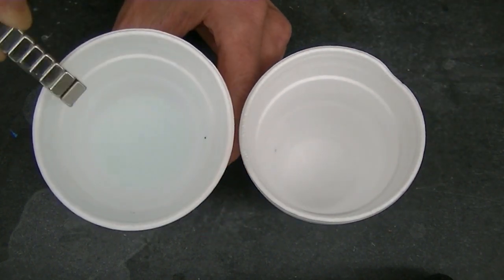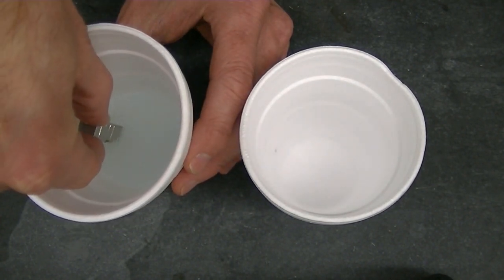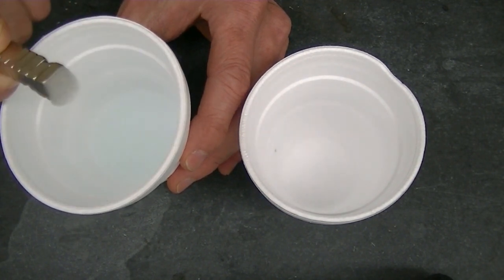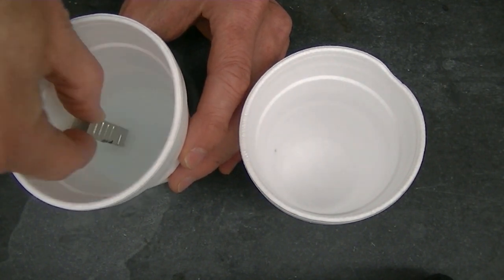Let's try the liquid oxygen. Put the magnet in. Oh yeah. I can see some liquid being attracted to the magnet in this case. Very easy to see.